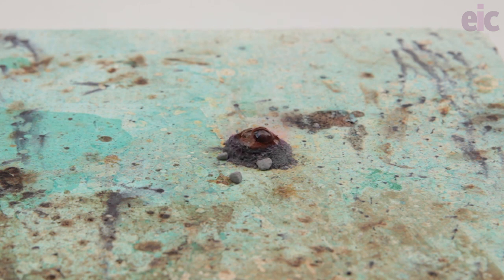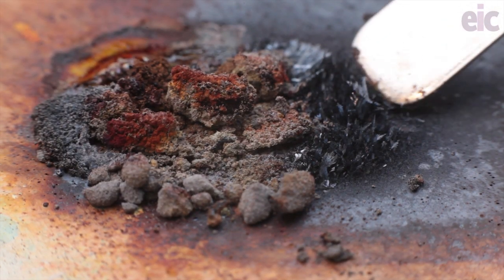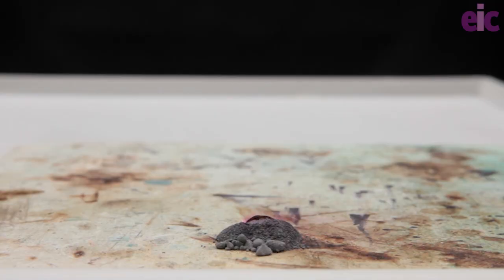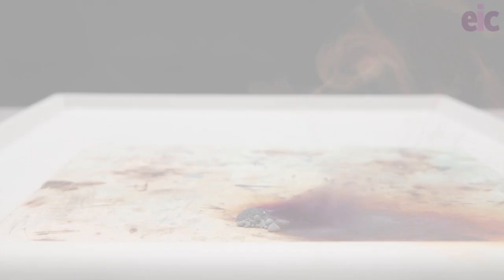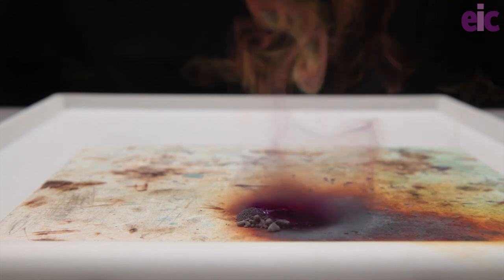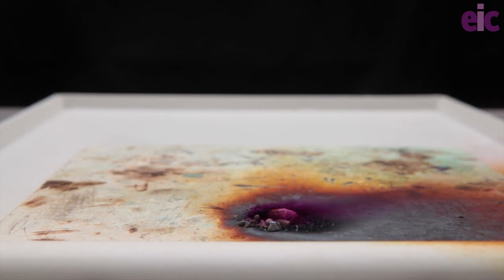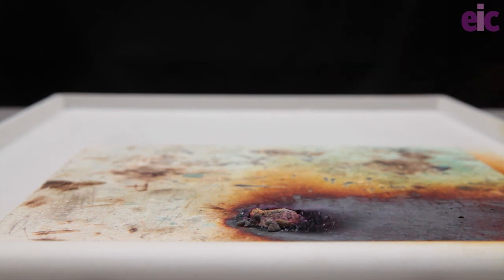The purple vapours we see here given off are iodine. This is obviously not a chemical reaction, because if they're cooled once more we would get our original iodine back. The evolved heat that's causing some of the iodine to sublime is itself however a sign of a chemical reaction, as is the change in colour of the solid. We now have a largely uniform and completely different colour from before, which will range from white through to pale browns according to how many impurities are present.